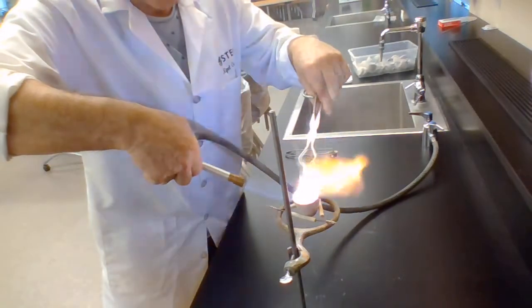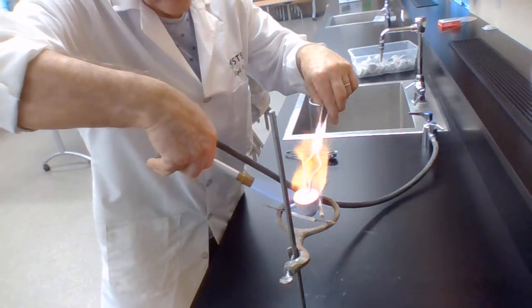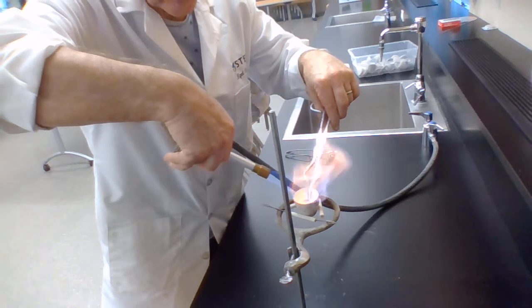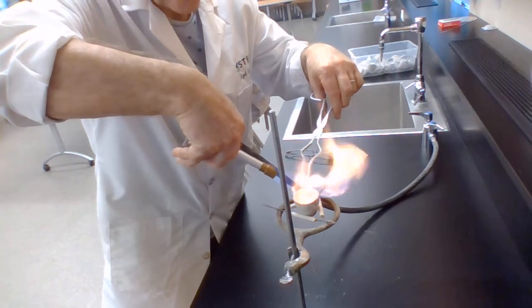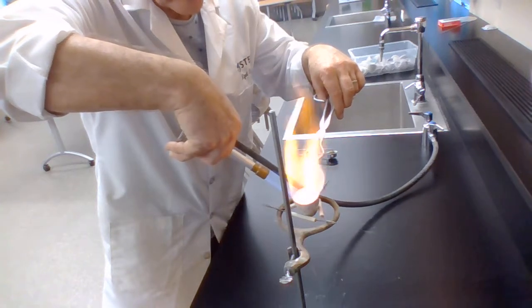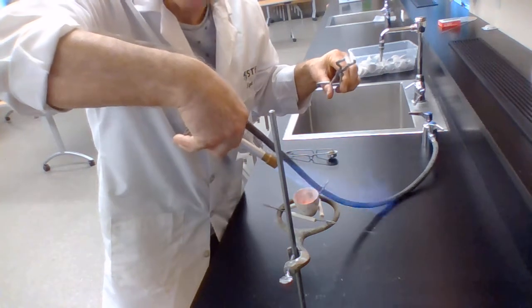I shouldn't be looking at this, so I'm not. The reason I shouldn't be looking at it is like a welding flash. And there's quite an amazing sort of intensity of light there that would be rather nasty for my retinas were I to look at it. You, on the other hand, are looking at this on a screen. And your screens are designed to certain safety protocols, and those safety protocols mean that they're never going to reach a light intensity that's going to damage your retinas. So you're quite safe.